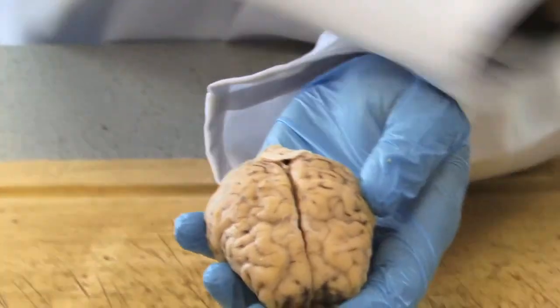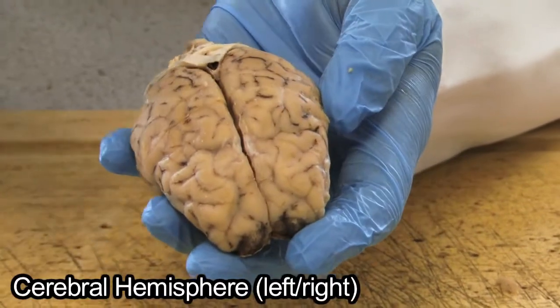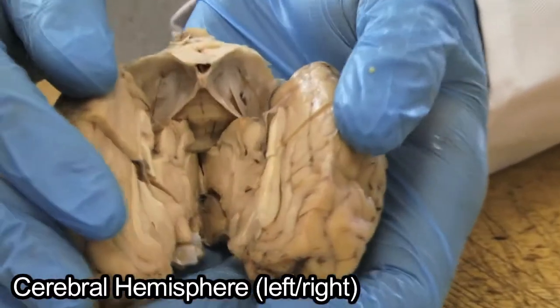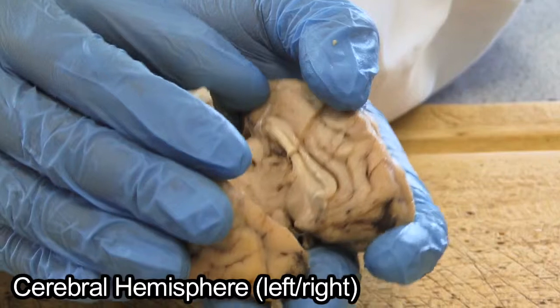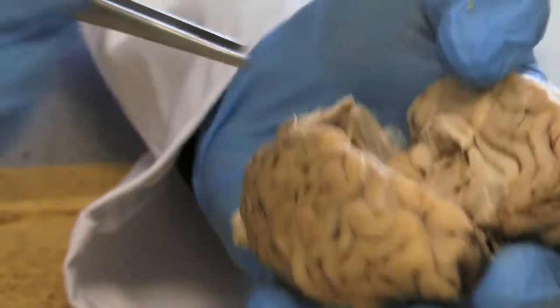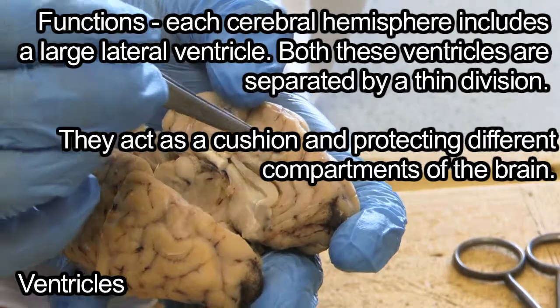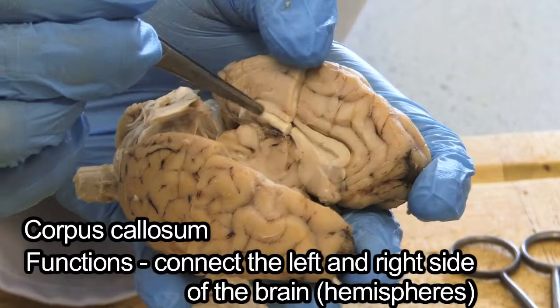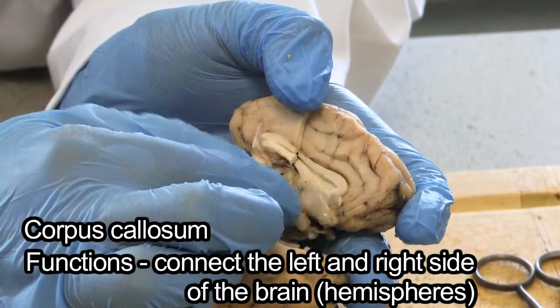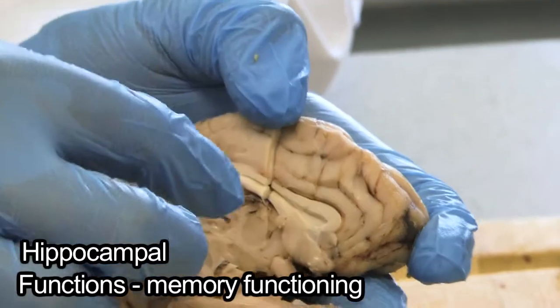Now, when we dissect the brain through the center, each side of the brain is referred to as a cerebral hemisphere — so you've got left and right cerebral hemispheres. When we dissect straight down through the center, we can see the gap present just here, referred to as the ventricles. The structure around it is the corpus callosum. Looking even deeper, we also refer to this area as the parahippocampal area, and within that there is the hippocampal area.